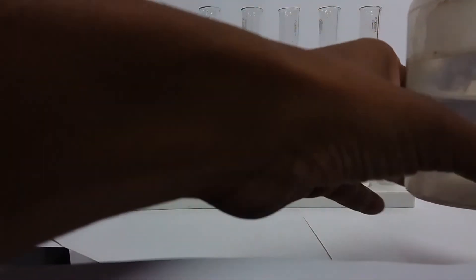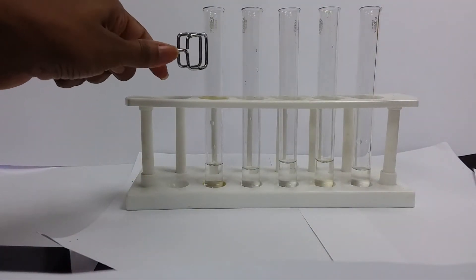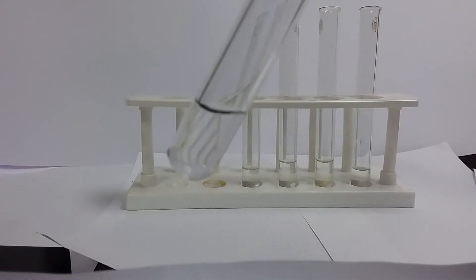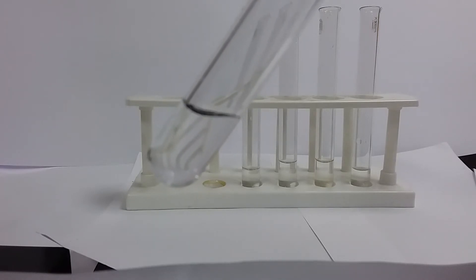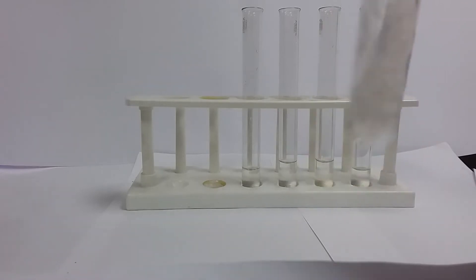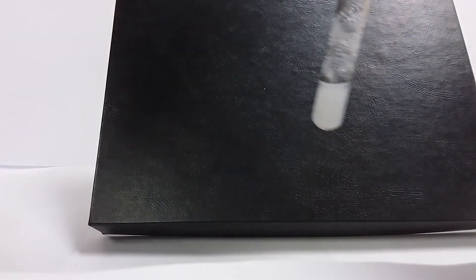Our first test involves sodium hydroxide, and sodium hydroxide is a colorless solution. We're adding dropwise — though we won't write 'dropwise' in our notes; we'll write a complete statement, which I'll discuss in a bit. We're paying attention to what happens. So this is what happens when we add one or two drops of our sodium hydroxide. What is our observation here? What are you seeing?